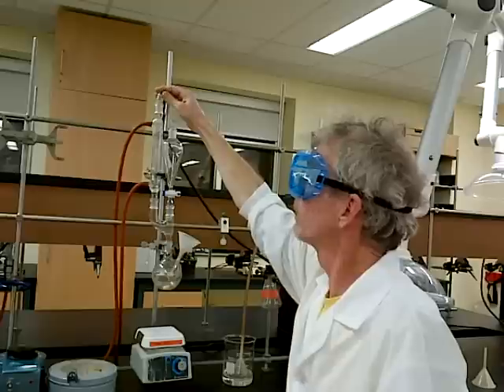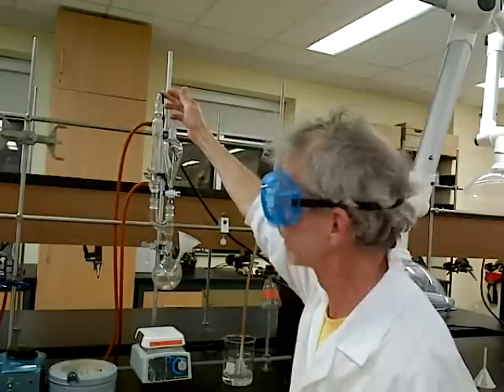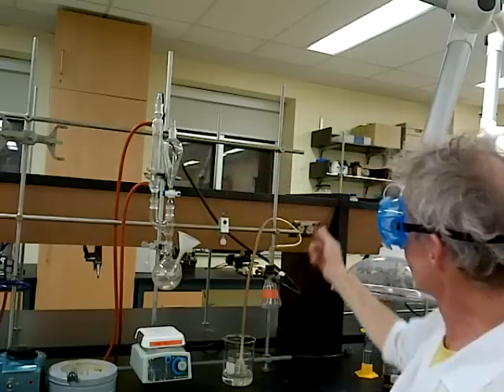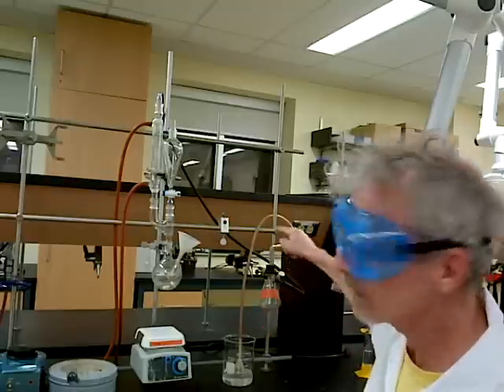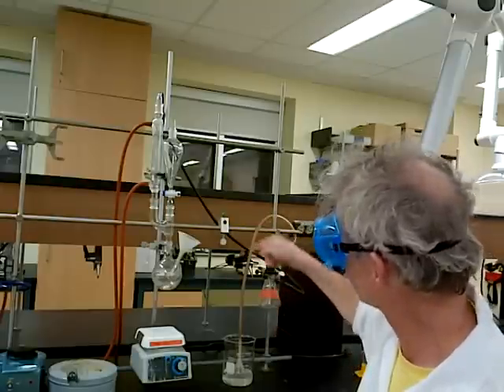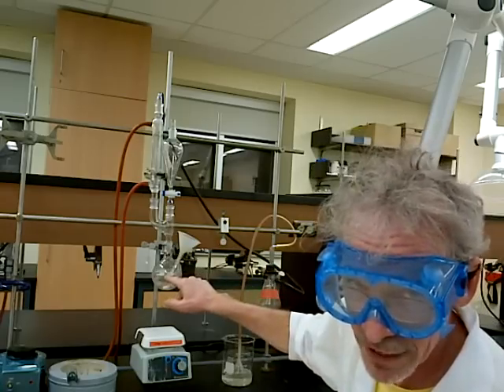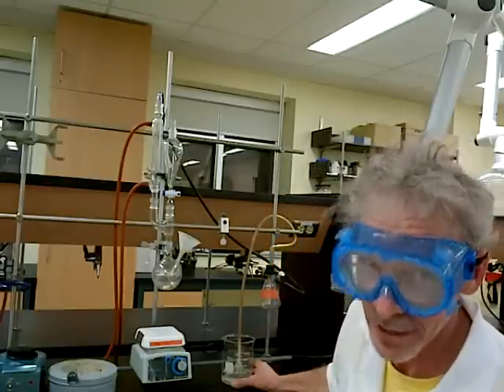At the top we have a hose adapter. That hose is Tygon tubing, and it's all black and horrible because it's been exposed to acid vapor for years. It comes down into what looks like a suction flask, but there's a tube and a rubber stopper — this is a safety trap. Coming out of here, through this piece of Tygon tubing, we're going into sodium hydroxide. The contents of this flask will be acid, and this sodium hydroxide is to trap the acid vapors so we don't all start coughing in the laboratory.